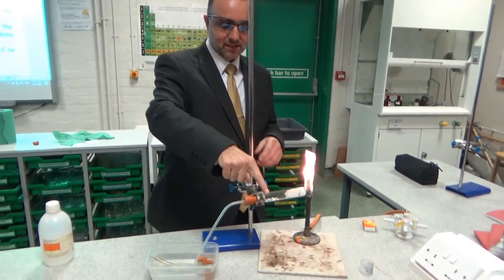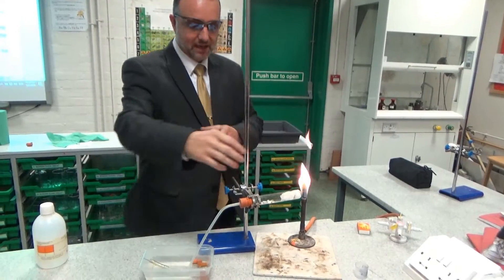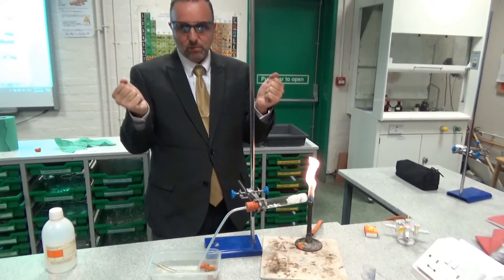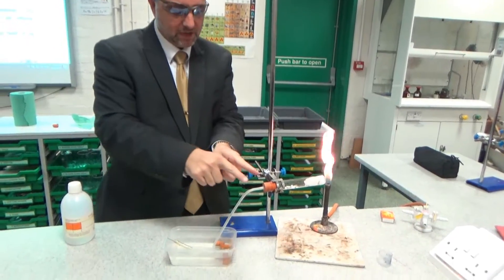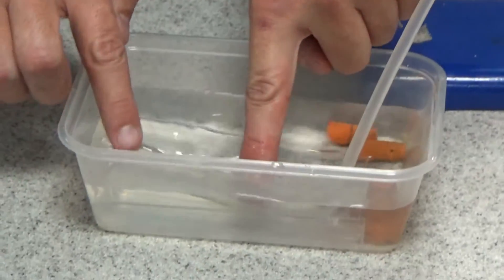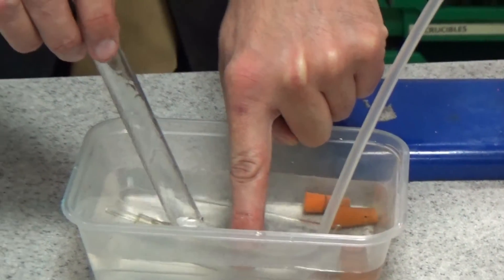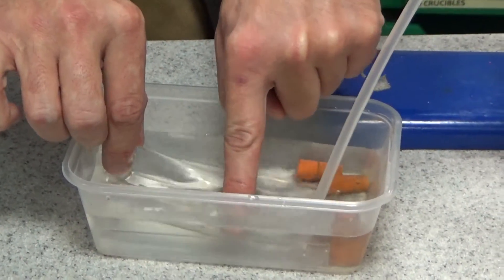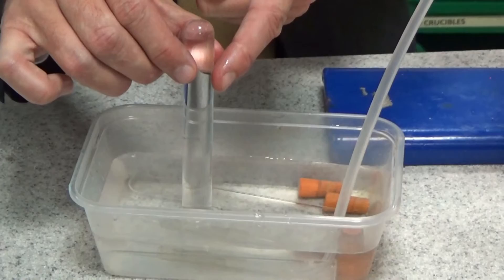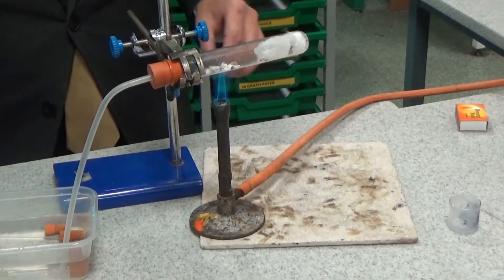So what am I going to do? I'm going to heat this catalyst here and get it really hot. Once I've done that I'm going to heat the paraffin part, and then the vapours will pass over the catalyst. As they pass over that hot catalyst, the molecules will be cracked. When they're cracked, I'm going to want to collect those gases that come off because they're our cracked product. I'm collecting it through this mechanism here — it's a tube with a hole in this piece of plastic and the bubbles will come out. I've got tubes in here filled with water, so the gas should displace it. You have to make sure it's right down, placed just above the hole — and that's now filled with water, ready to accept the gas.